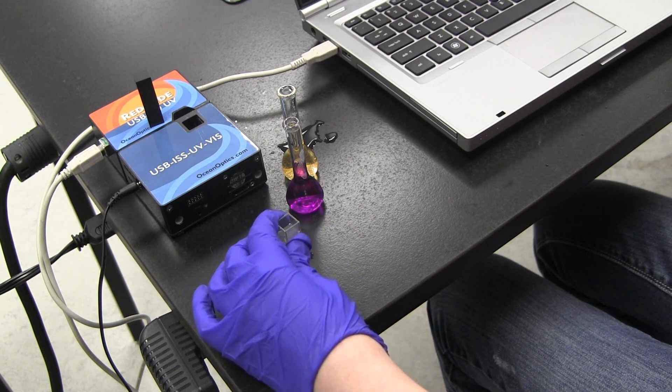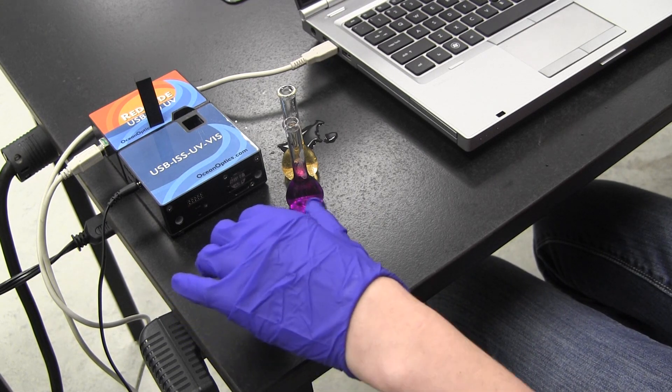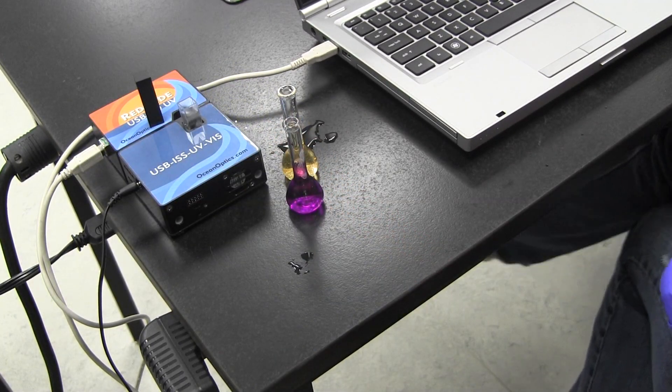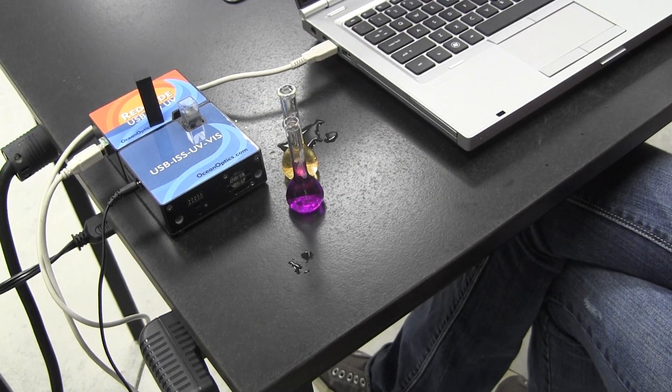Now you will need to follow the procedures for quantification of unknowns. Remember, cleanup after this lab requires the metal containing solutions to be disposed of in a special container.